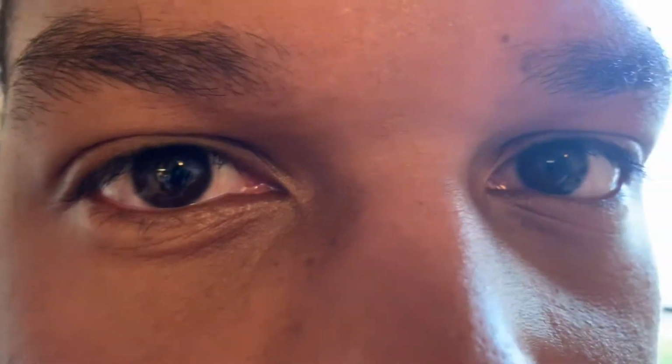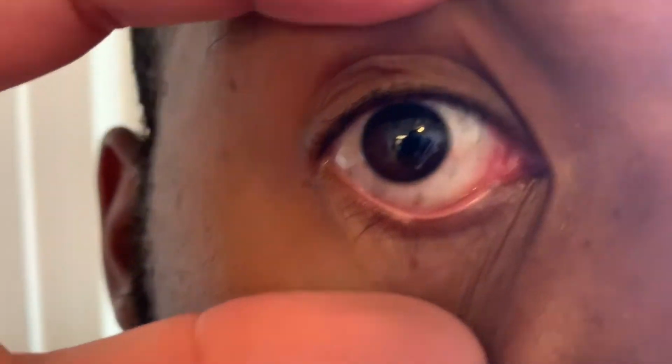Now we're going to do the pupillary light reflex. What happens to the diameter of the right pupil when you briefly shine the flashlight into the right eye? The size of the pupil basically changes in response to the light. With more light, the pupil closes and the iris reduces to allow less light to pass through the retina.